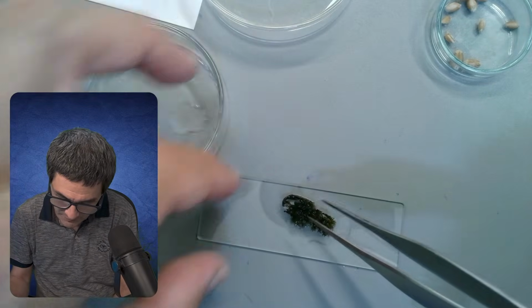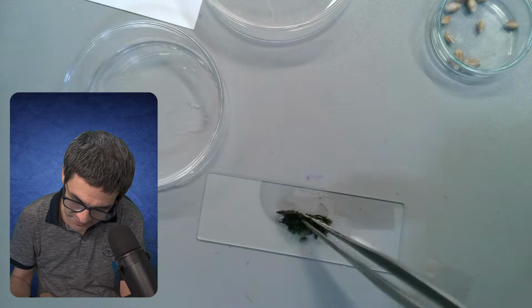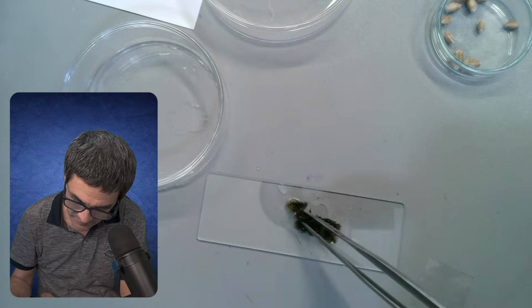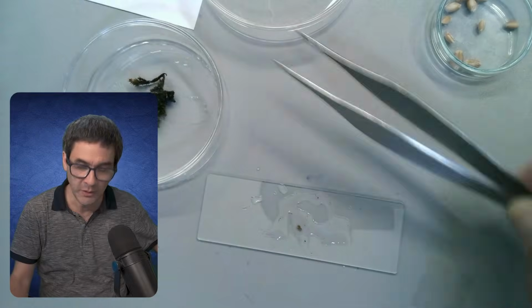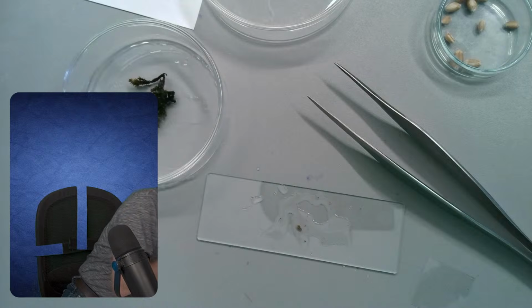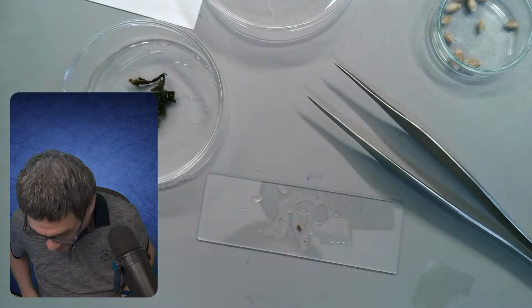But sometimes, if there is something solid, then you're able to get it off. But I'm not always very optimistic about that. So we always have to do a little bit of trial and error.